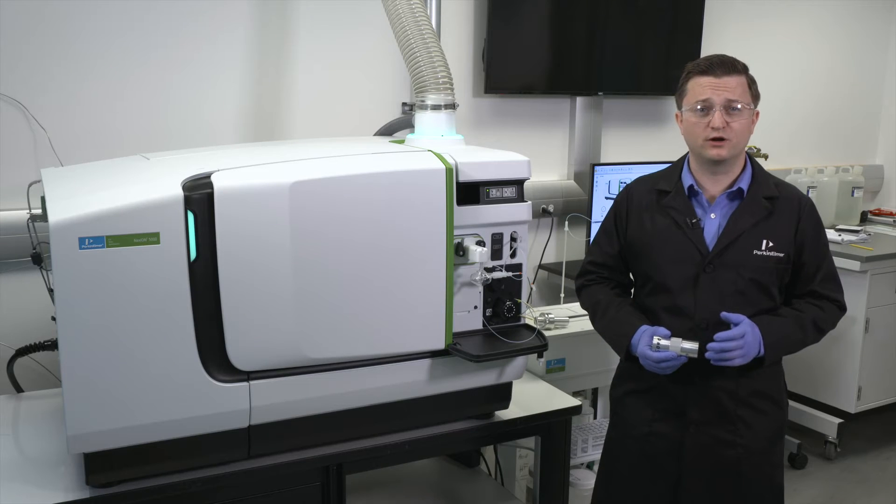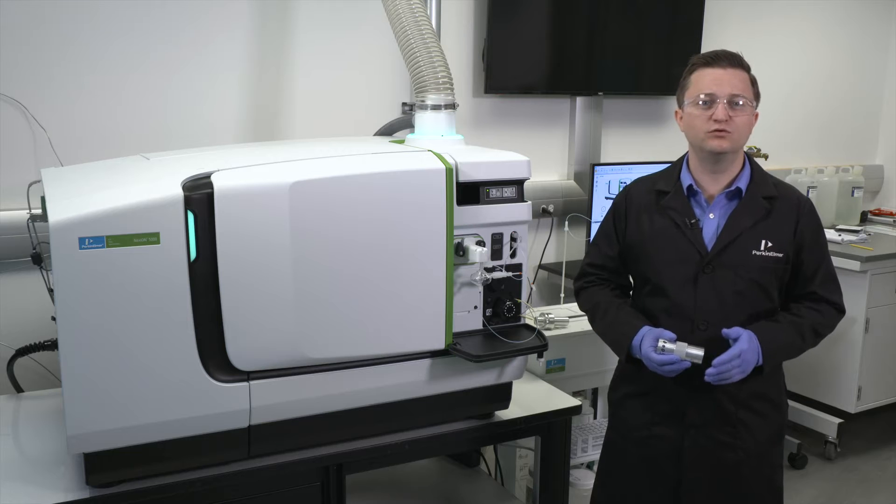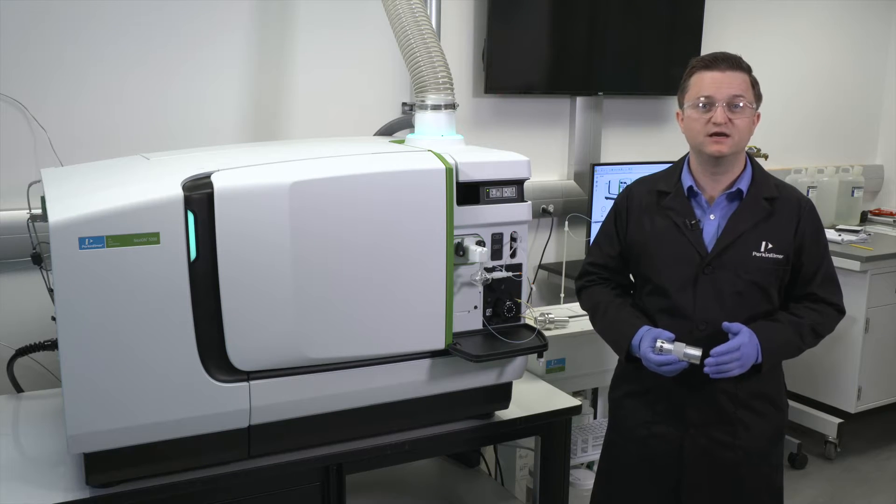Hi, welcome to a brief PerkinElmer video to help you get the most of your Nexion 5000 ICP-MS.